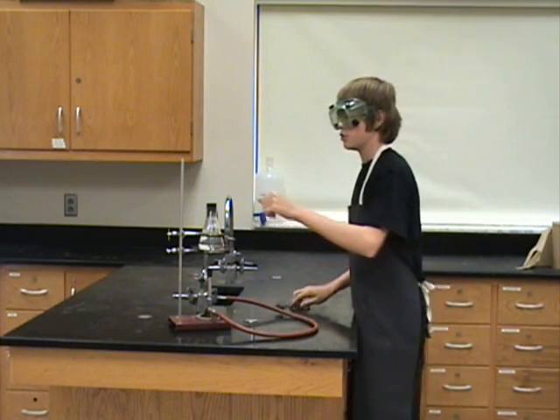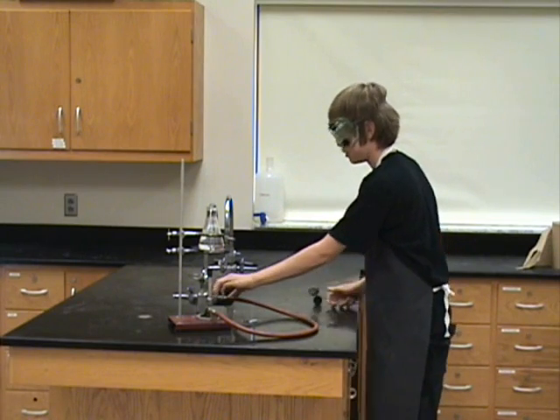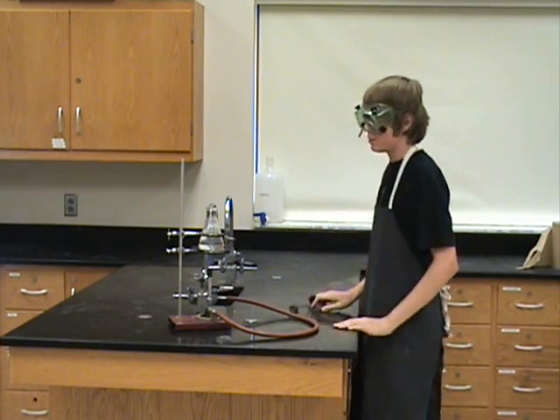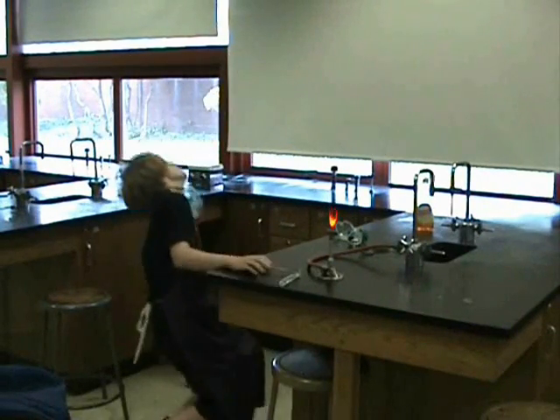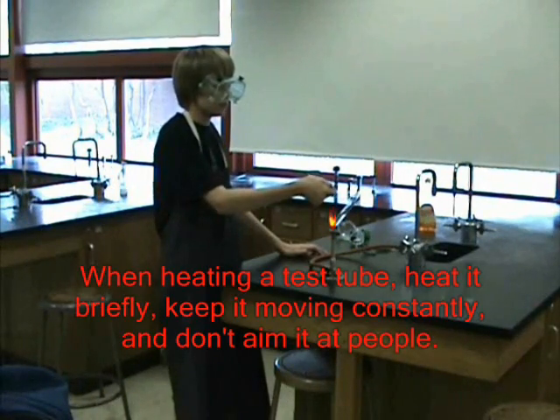Oh, wait a minute. There's a stopper in this flask. I've got to remove it so I don't blow my face off. Observe as this student incorrectly heats a test tube. Oh! Observe as the student correctly heats a test tube.